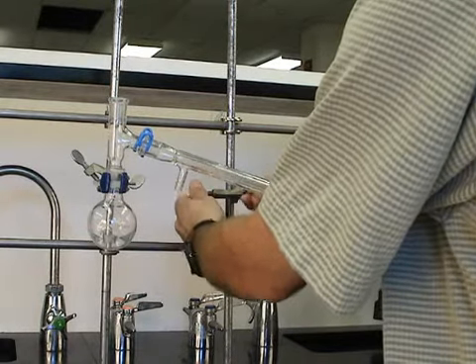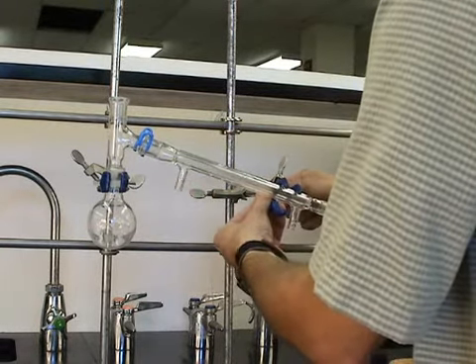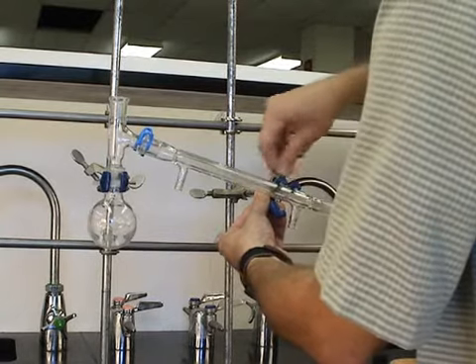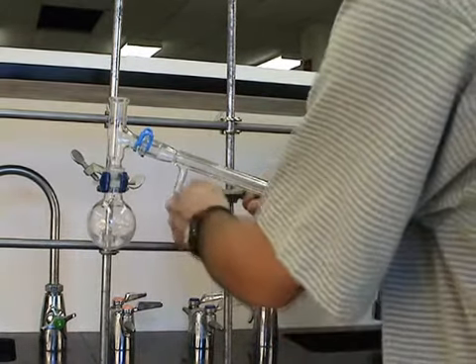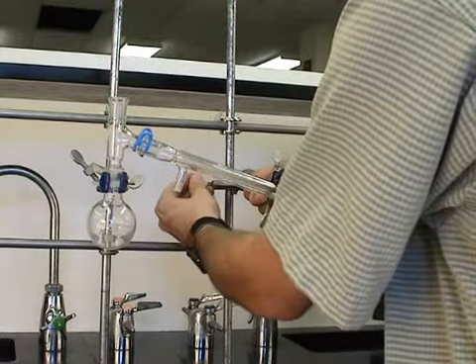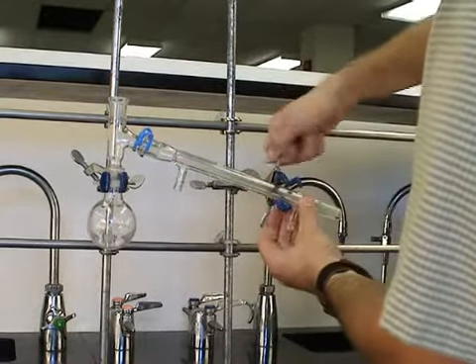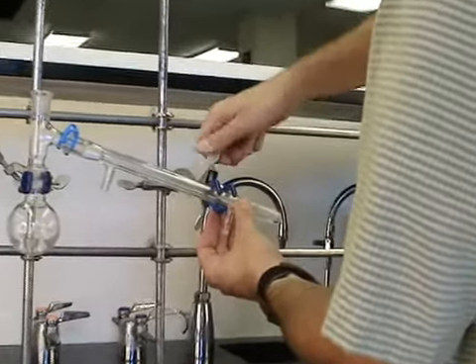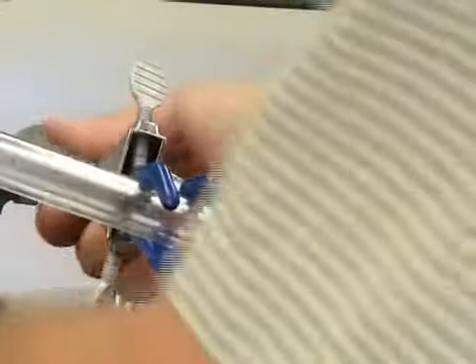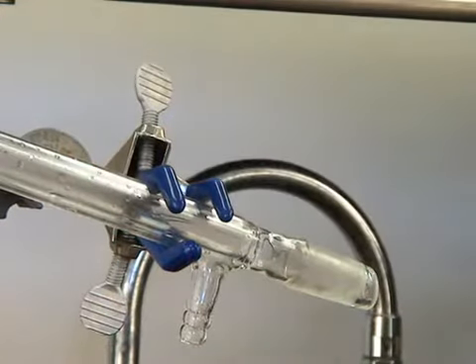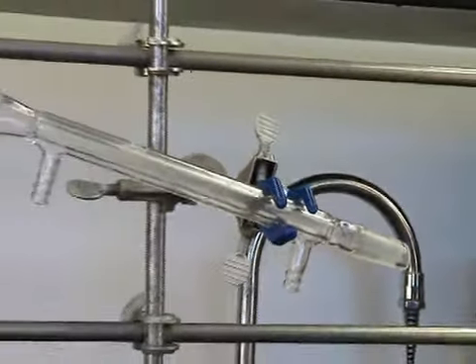Now we simply make a series of adjustments to position the clamp around the condenser. Make sure you don't move the condenser. Move the clamps until you get them properly positioned. And then gently snug the condenser clamp. It's acting more as a support here than a firm clamp.